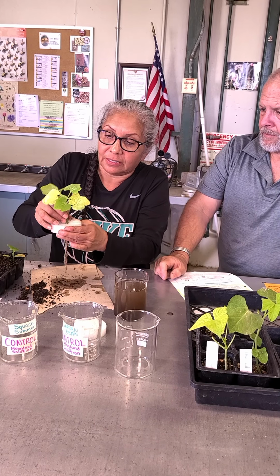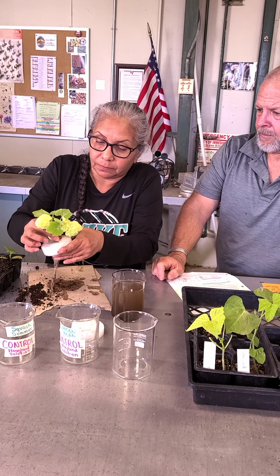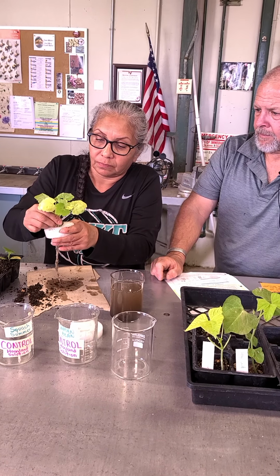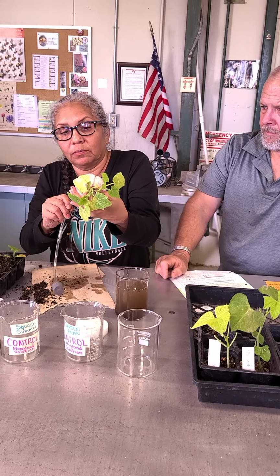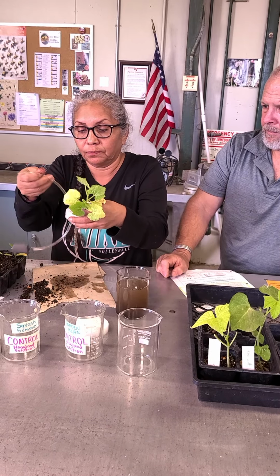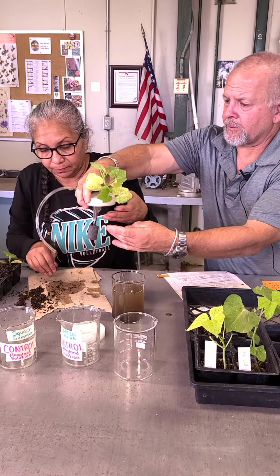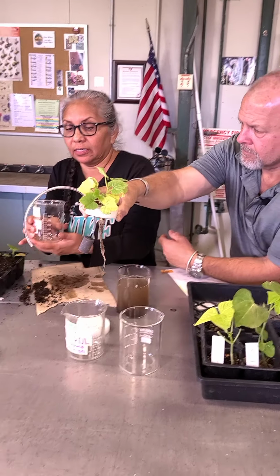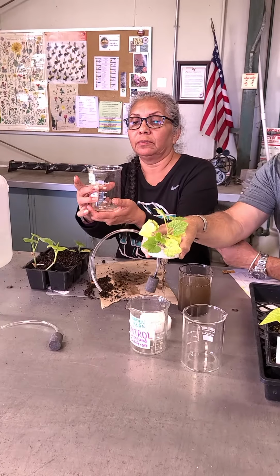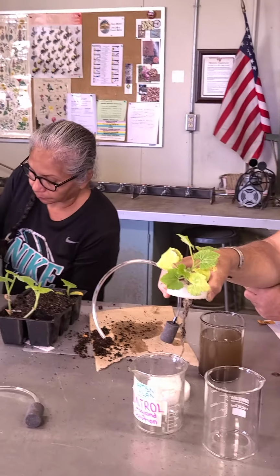like this. And then after that, try to put one of these in one of the holes. And just to make it easy, I'll go ahead and hold this for you while you do the next part. And then fill the beaker until 250 or 300 ml. And it's not really critical the amount. We want to make sure that it's adequate.